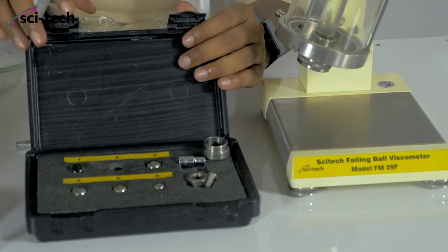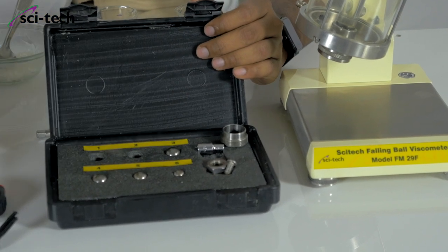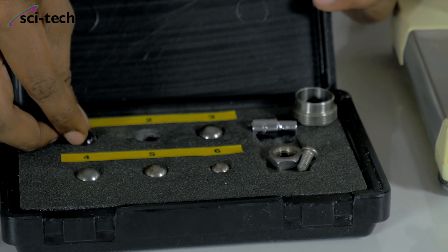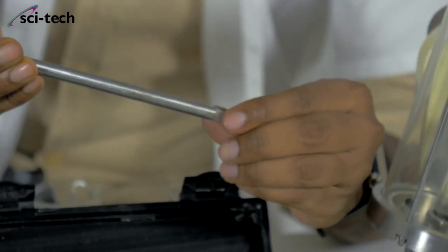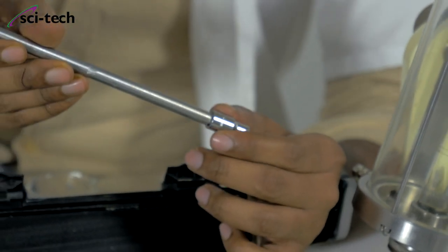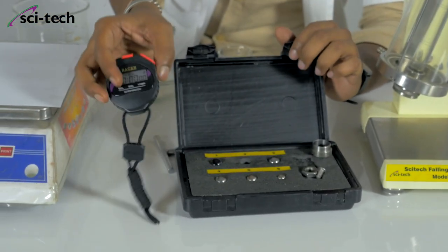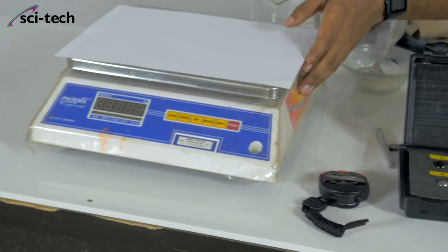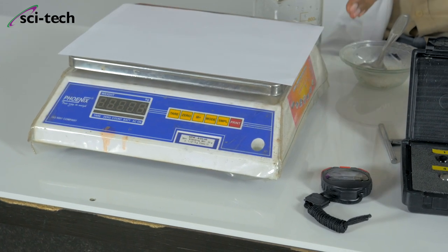We have auxiliary equipment — this black box contains the metal balls and glass balls for performing the experiment. There is also a mechanical arrangement with a spanner for opening the glass tube for cleaning purposes. We have a stopwatch for timing, and an electronic weighing scale to measure how much solute to add for making the solution.